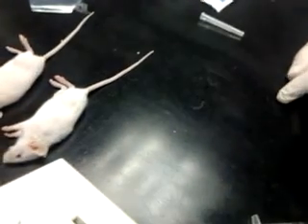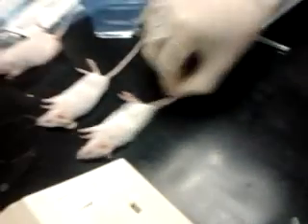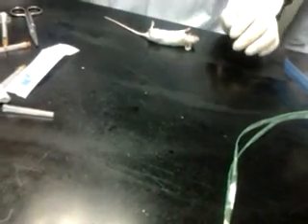Now we're going to do it on the rat. Can we try the cardiac puncture once more before? Which one do you want to do cardiac puncture on? Anyone, or maybe you just want to see the technique. Since these animals are already well sedated compared to the rest, I can do cardiac puncture and make sure that it's alive. I want it to be alive, and see how it recovers.